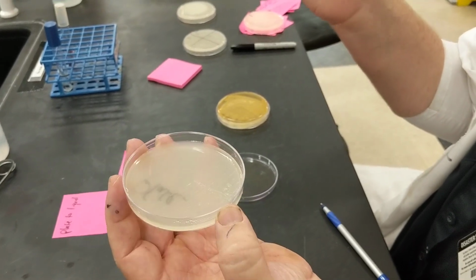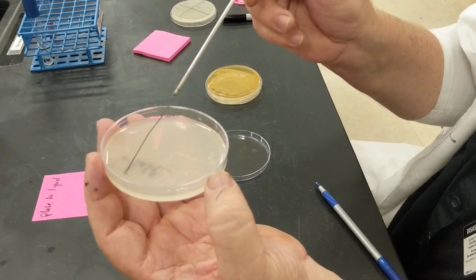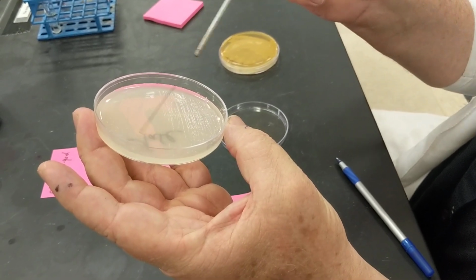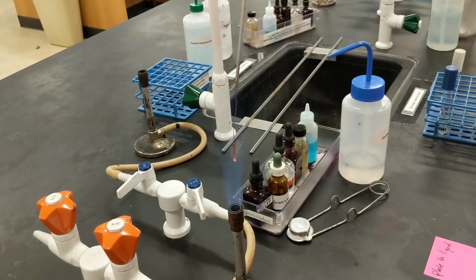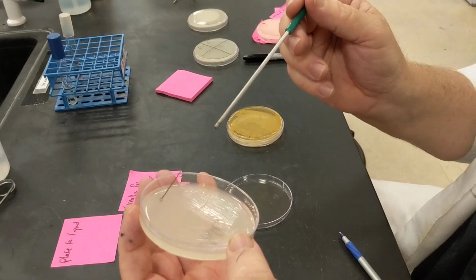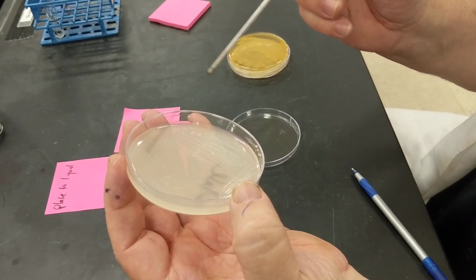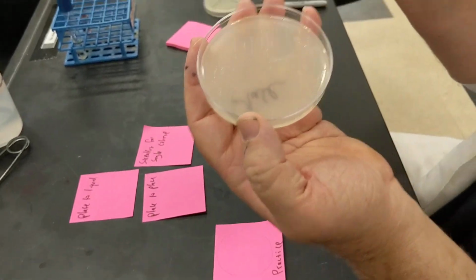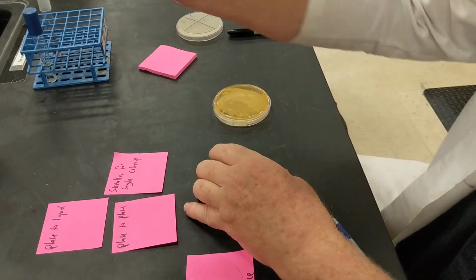If you notice, I just flamed my loop. I then rotate my plate a little bit, touch it to make sure that it's cool. And then what I'm going to do is go back over it a couple of times, and then I go over my culture. If you notice, I'm not going over the top of it. I then flame my loop again, get it all red hot. Go over here, I touch it. I then go a couple of times, and then I move it kind of back and forth. This loop here is kind of damaged and it's scratching the agar, but I wanted to do this so that you can see it. And so if you see, you have a specific pattern in your agar, and that's the pattern I'm going to be looking for.